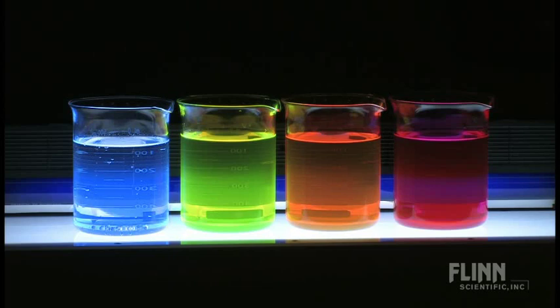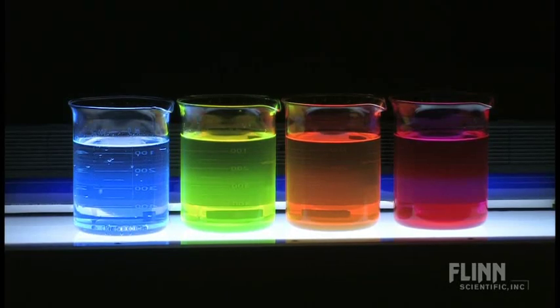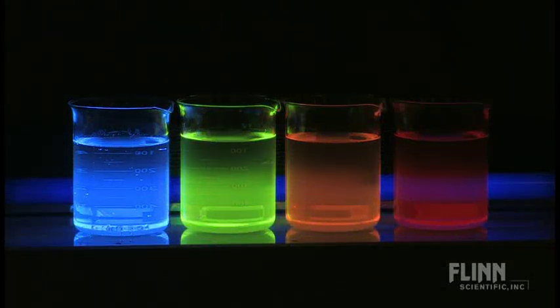I'm going to turn off the light box underneath them and that should give us a much better fluorescent view of the fluorescent colors. Now you can see the bright blue of the quinine, that's the fluorescence. The fluorescein was a yellow color; it's now glowing a bright green, still a yellow-green but a greenish color.